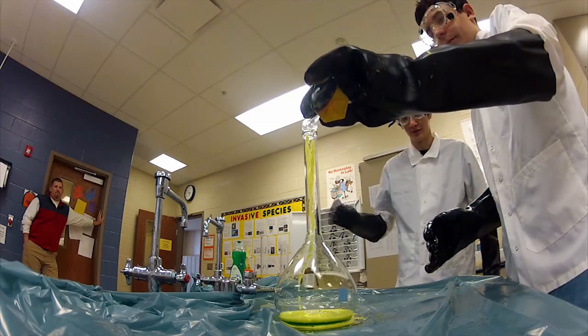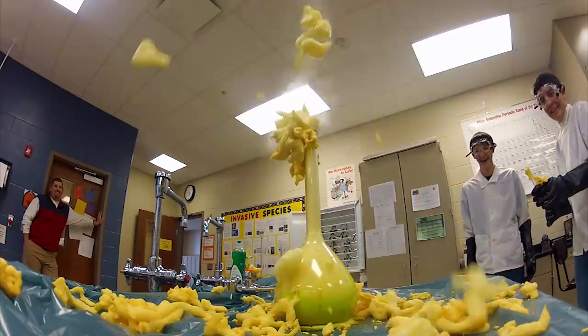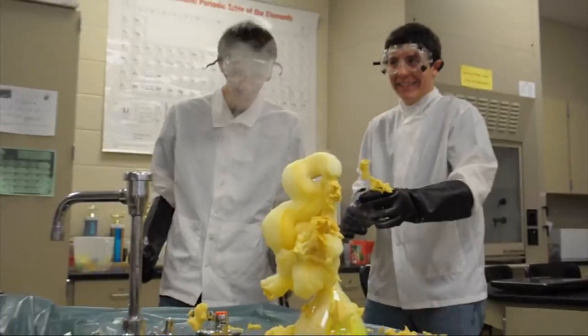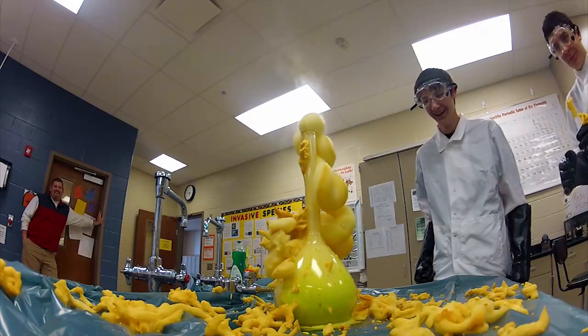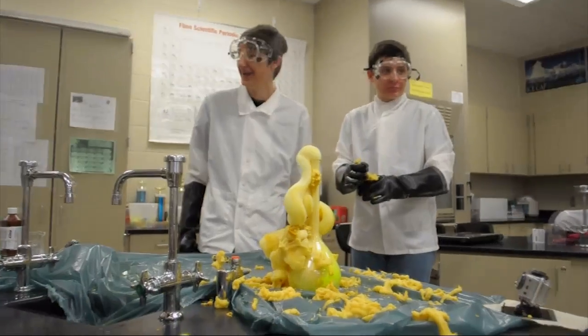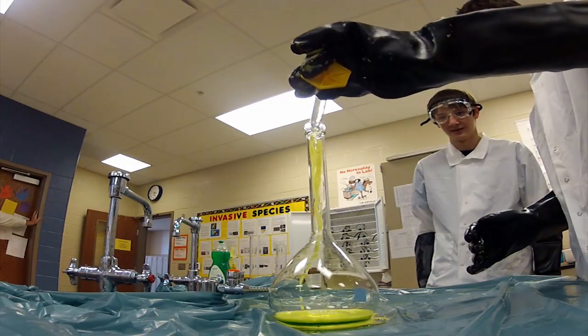Just right, quick left, quick left. Because of the reaction taking place so quickly and the oxygen gas needing to escape, the foam shot out of the top due to the buildup of pressure and the small opening in the flask.